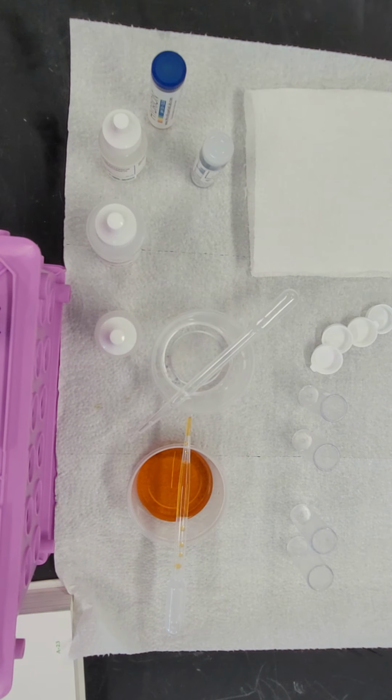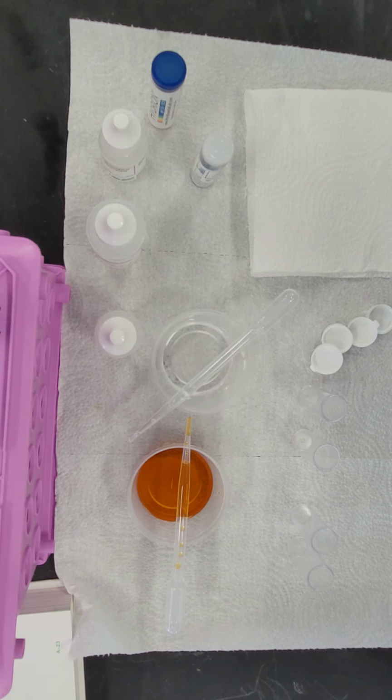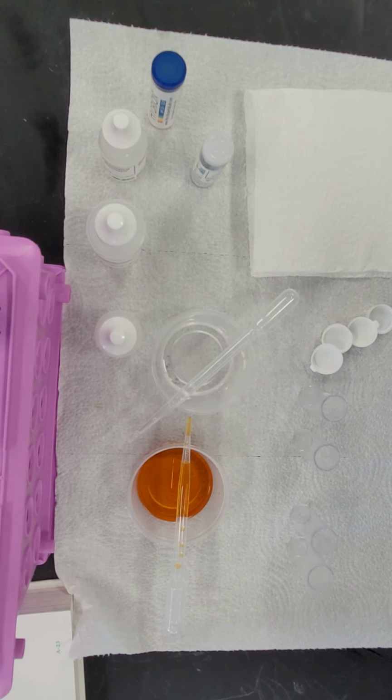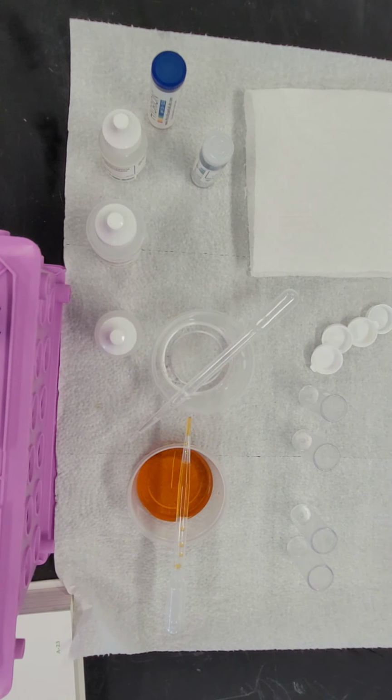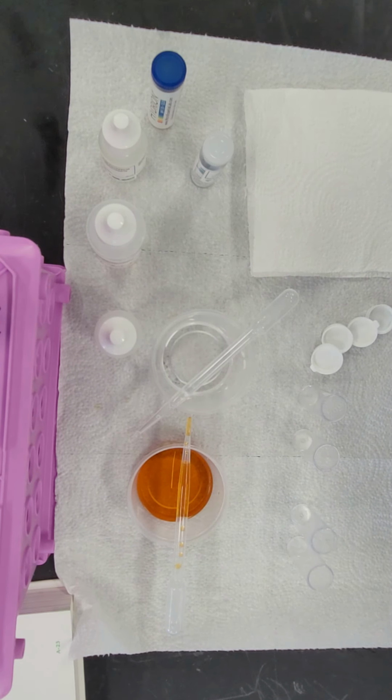My orange substance is lighter because, unlike mine, yours was exposed to some metals that began corroding inside your unknown substance, and it was very hard to see the toxicity test. So we're using these to make sure you could see how your test should have come out, to include the toxicity test, so that it's easier to identify whether or not the substances are toxic.